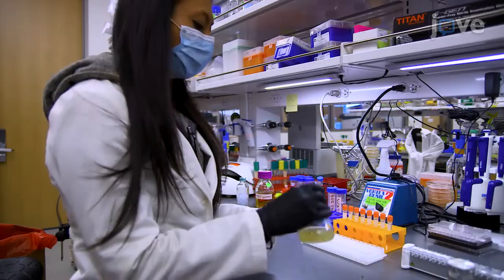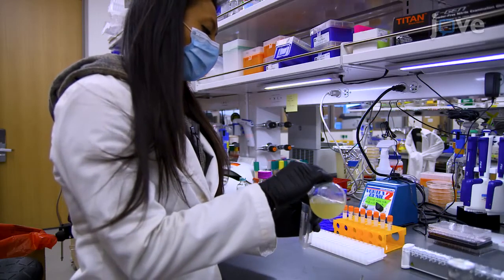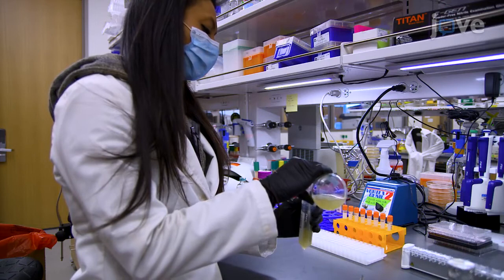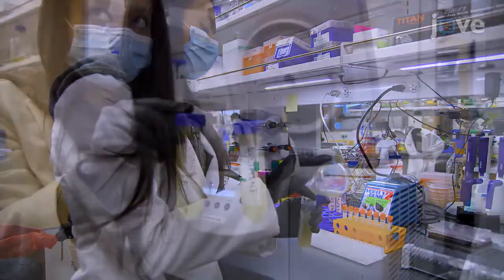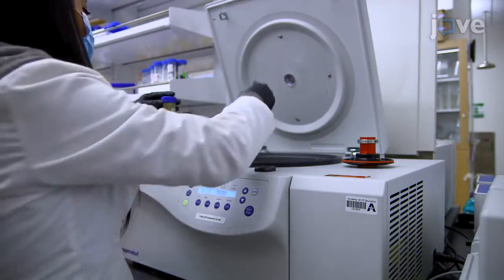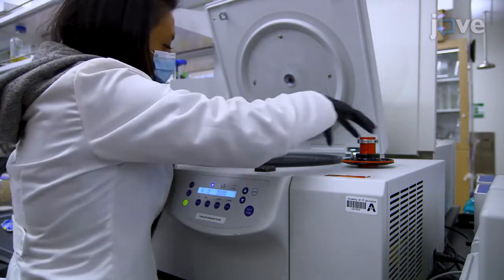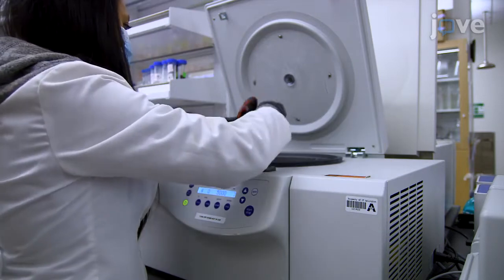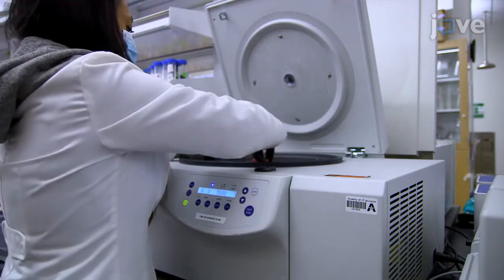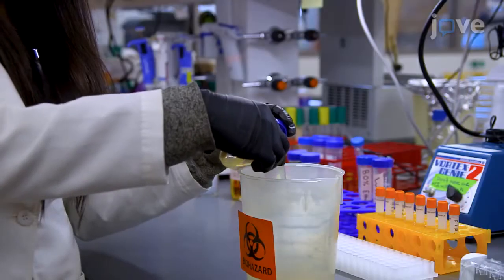To begin, transfer overnight cultures to 50 mL conical tubes and pellet both recipient and donor cultures using centrifugation at 5,000 times G for 7 minutes. Discard the supernatant.